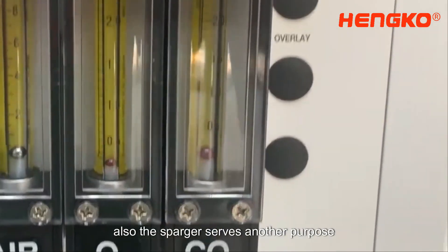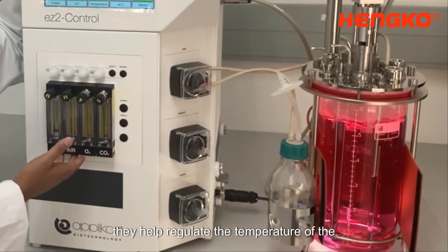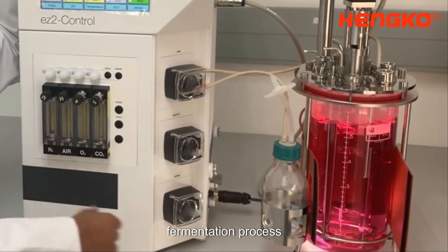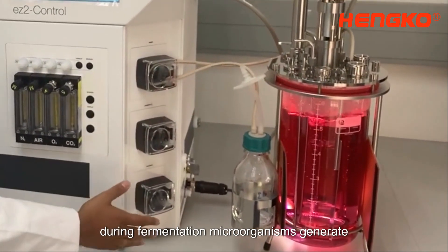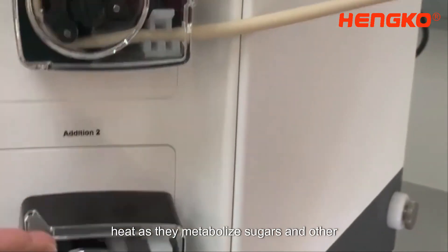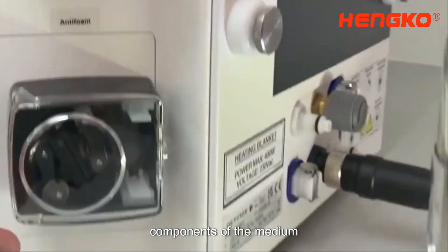The sparger also serves another purpose: it helps regulate the temperature of the fermentation process. During fermentation, microorganisms generate heat as they metabolize sugars and other components of the medium.